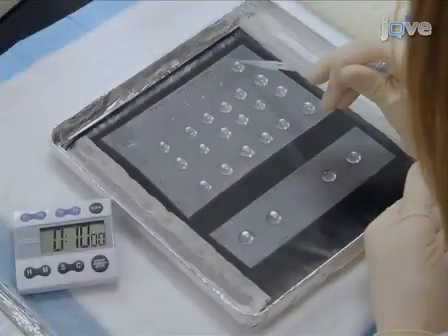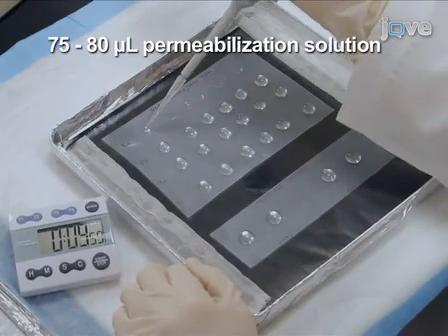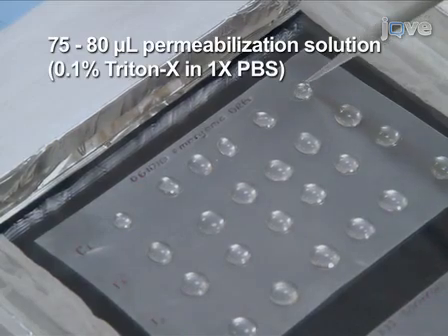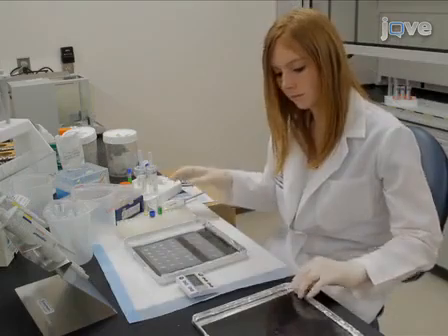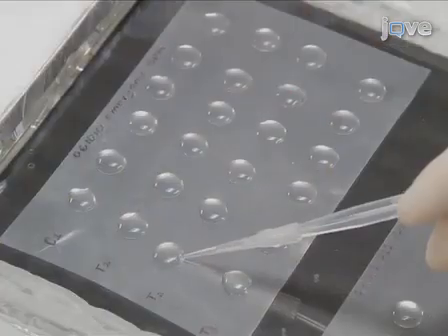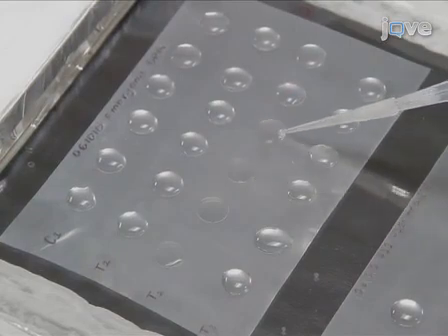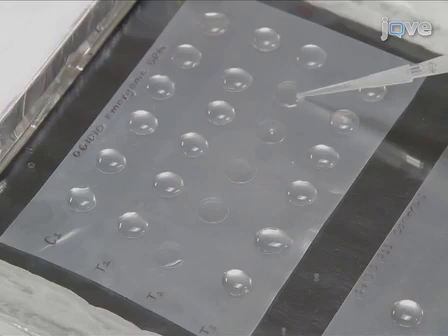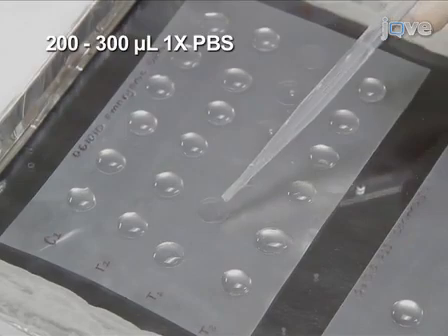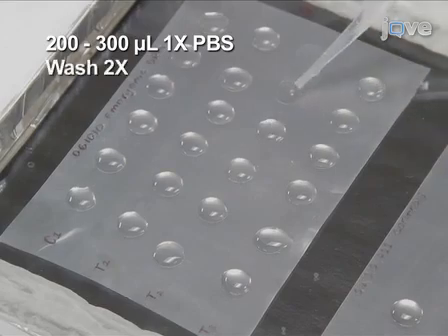To label mitochondrial DNA, add 75 to 80 microliters of a permeabilization solution containing 0.1% Triton X in 1x PBS to each cover slip. Cover and incubate at room temperature for 10 minutes. Use a bulb transfer pipette with a 200 microliter tip affixed to the end to gently remove the liquid without losing cells. Use a bulb pipette to gently flood the cover slip with 200 to 300 microliters of 1x PBS to thoroughly wash out the previous solution. Wash each cover slip twice.